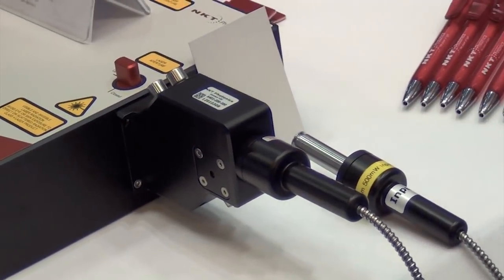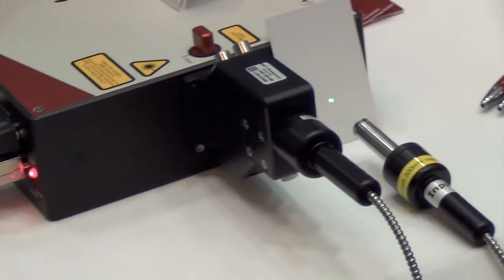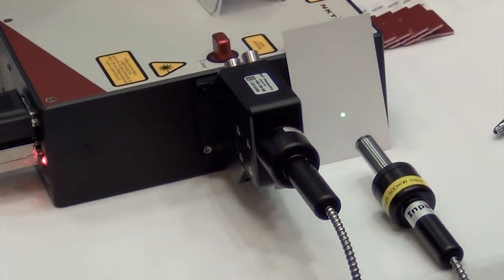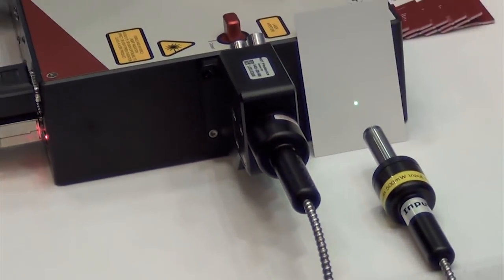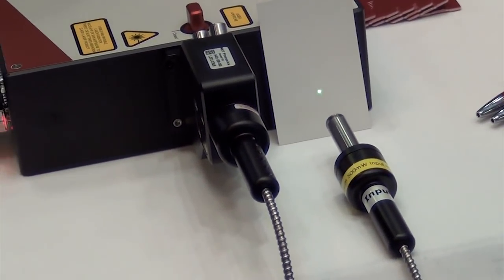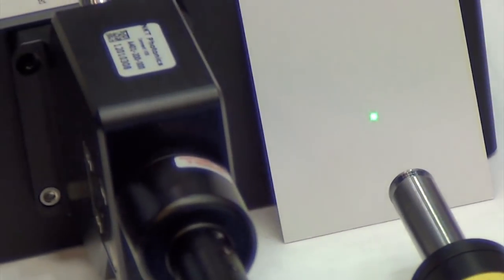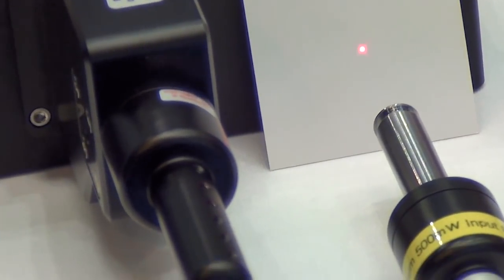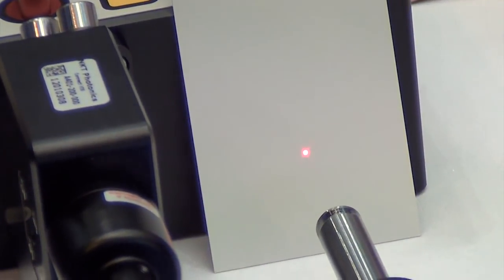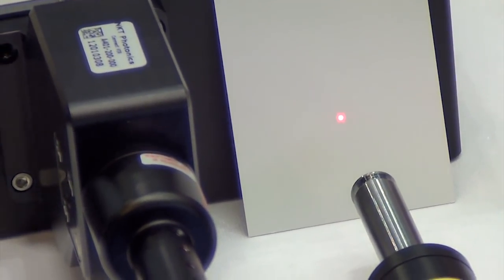Single mode output, diffraction limited — an extremely nice spot. I'm going to change that now — if you stay tuned on the spot, I will change it to red. And you can see that it is tuned over 100 nanometers in less than a second. So it is rapidly tunable as well, which is really nice.